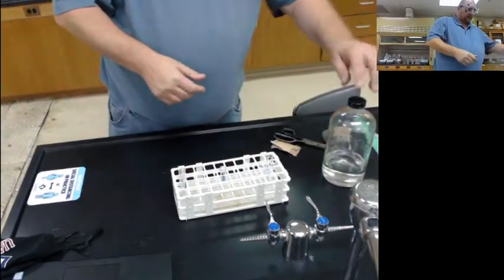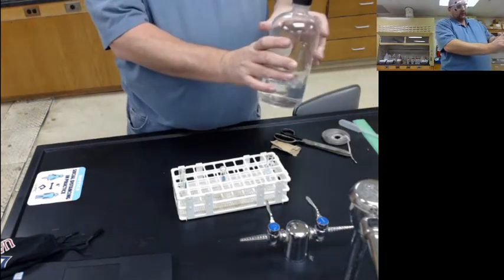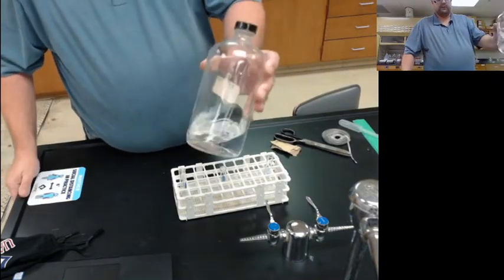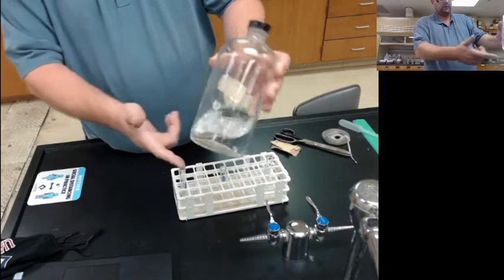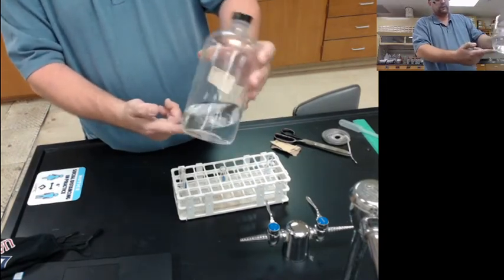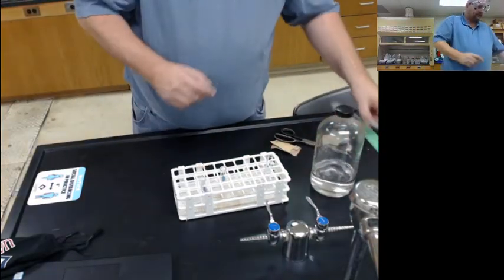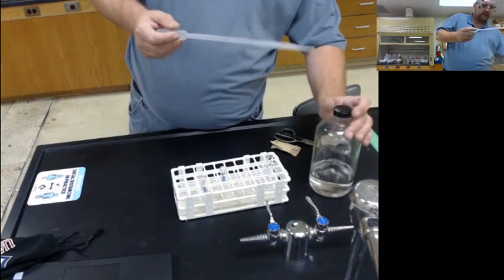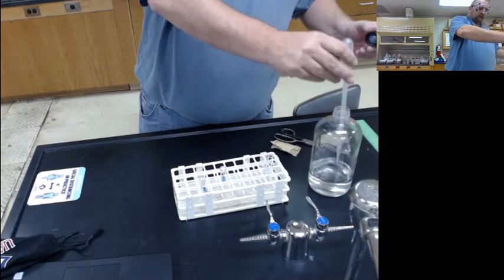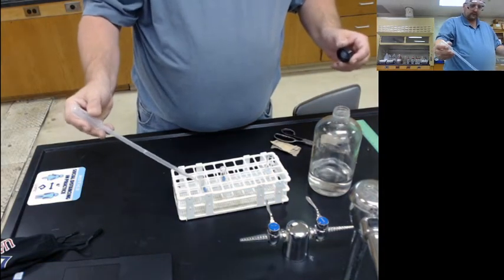Okay. Now I'm going to be adding in some HCl. The HCl I have is actually quite a bit more concentrated, about 30 times more concentrated than the procedure calls for, so I'll have to be careful with it. But you can see it is a clear, colorless liquid. There's no solids floating around in it. And I'll add this in. I just need to put a little bit in here to get this to react. And we're going to be looking for signs of a reaction. So I'll just add a few drops.